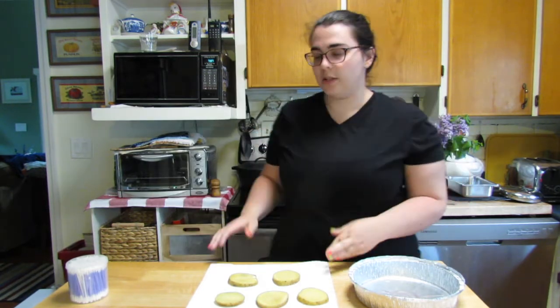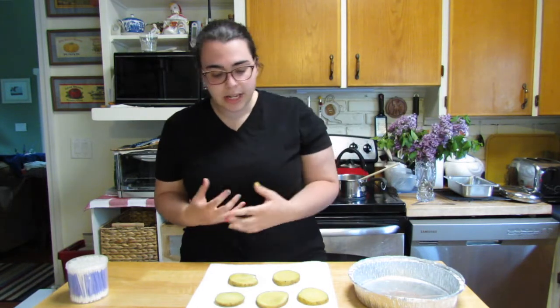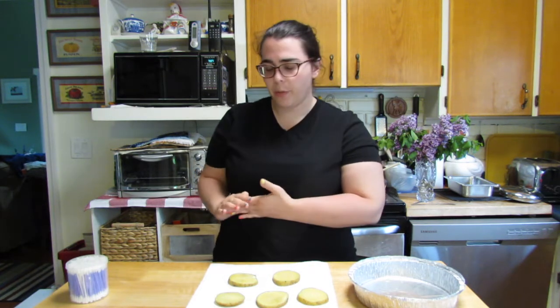There are a couple of reasons why these potatoes have to be cooked. The first is because a raw potato is quite sticky and starchy and it's not quite the environment we're going for. But the main reason is because boiling it is going to kill any of the germs that are already there. So we want to try to start with a clean slate.